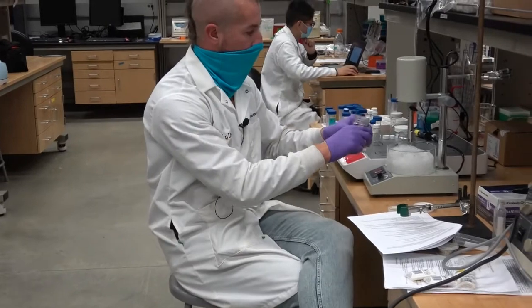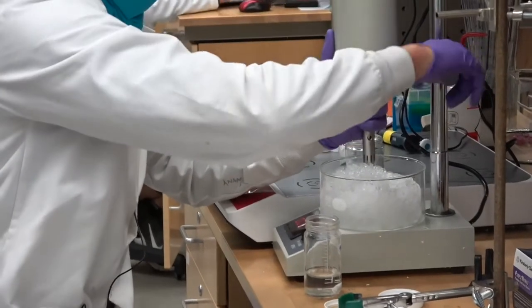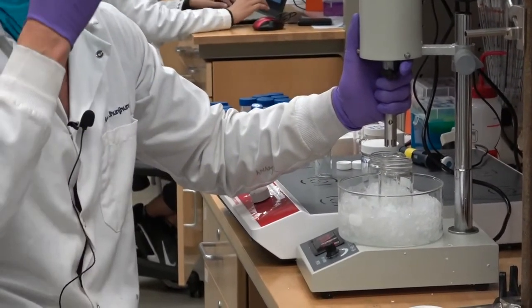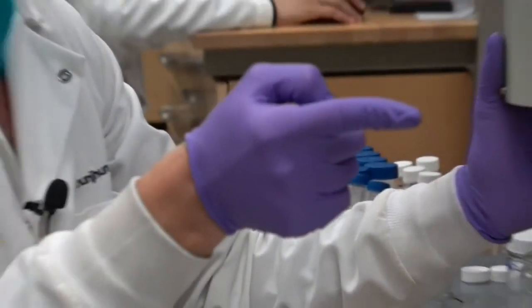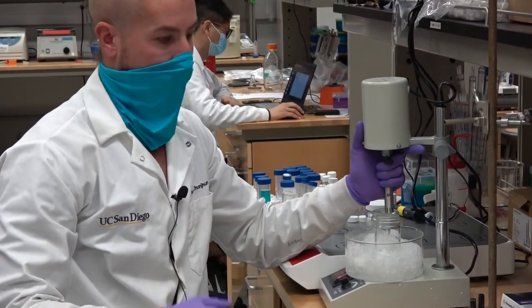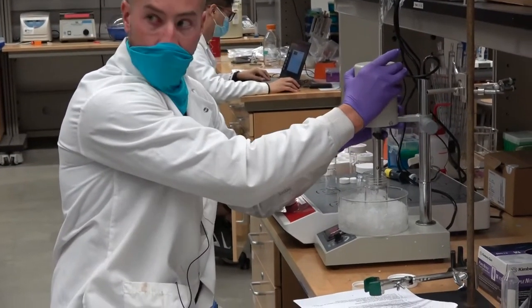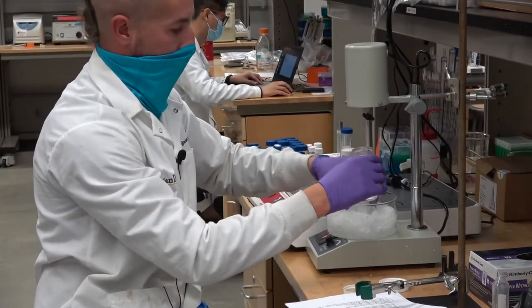Okay, so now we're going to put it underneath our homogenizer. And we're putting it in ice because this actually produces a fair amount of energy. And in fact, when I used to make particles with this tip sonicator a lot, dichloromethane is an organic solvent, so it evaporates pretty quickly, and you could evaporate it if you don't put it on ice. So that container is larger. Oh yeah, good point. So we're just going to switch this over.